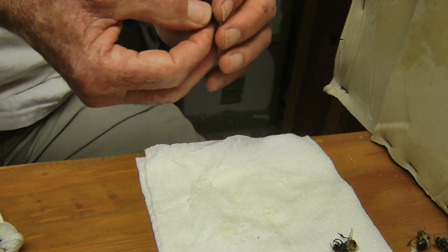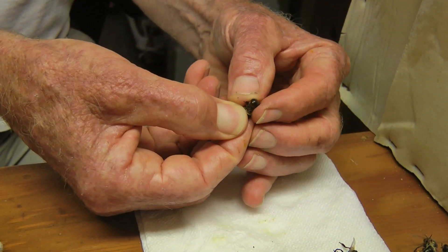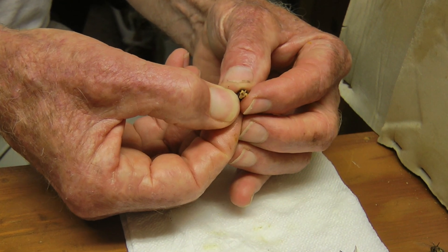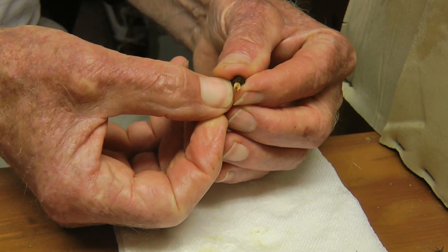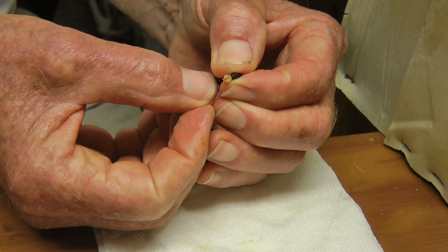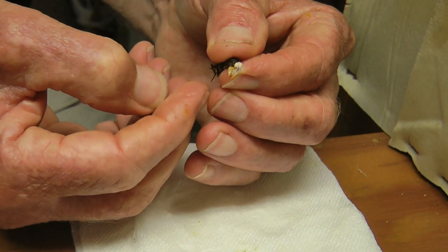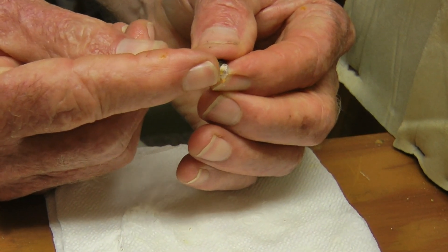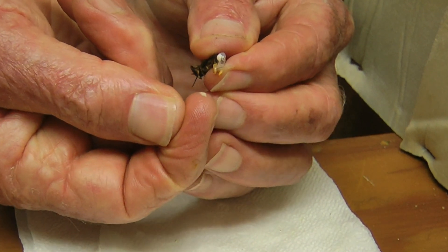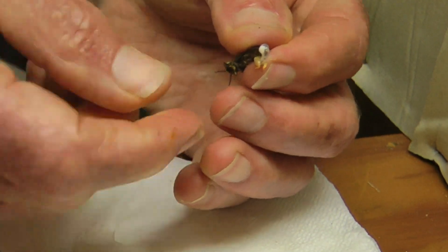Here's a nice drone. And I roll my finger up against the abdomen, and there's the endophallus. And here's the semen right here — you can see that. There's the semen. Now it's on my finger. The semen is the beige fluid. The white is mucus.